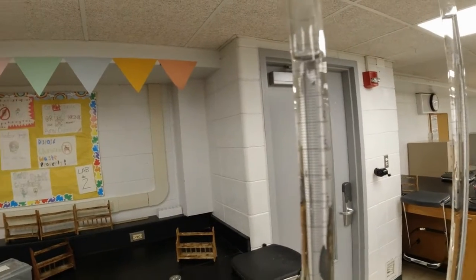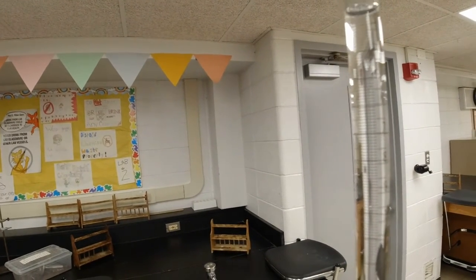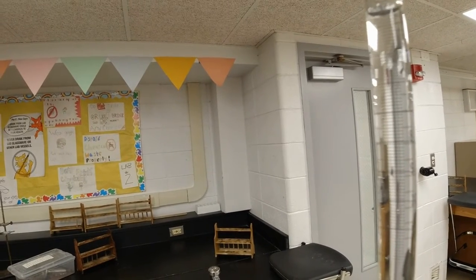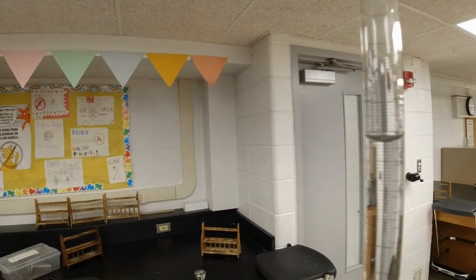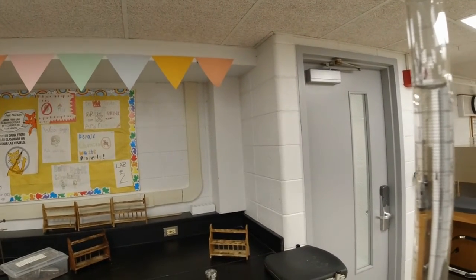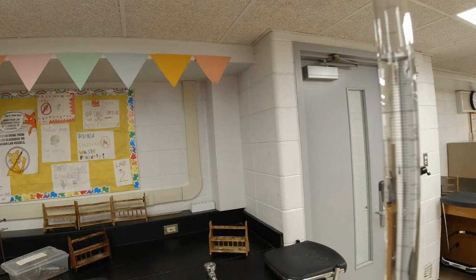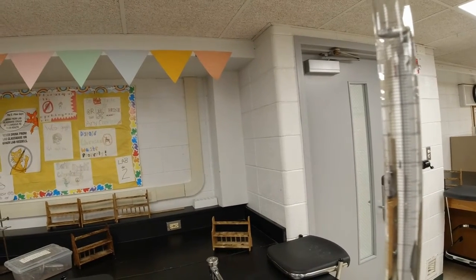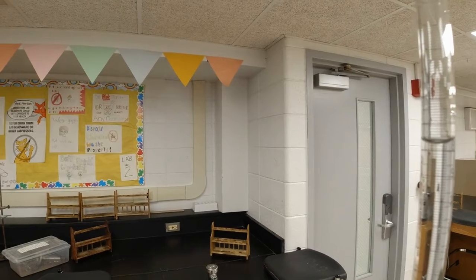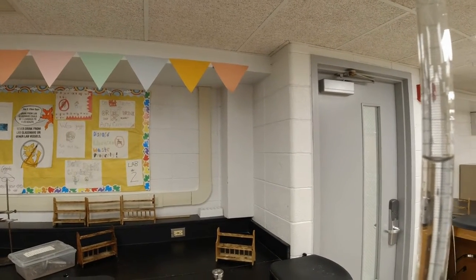And so now I'm down to 2, 2.5, 3, 4, 5, 6, 7 milliliters, 8 milliliters, 9 milliliters.